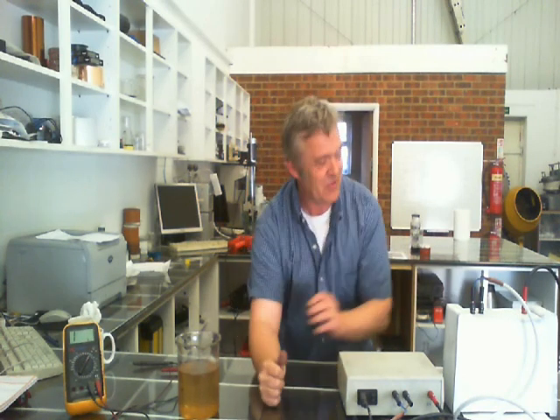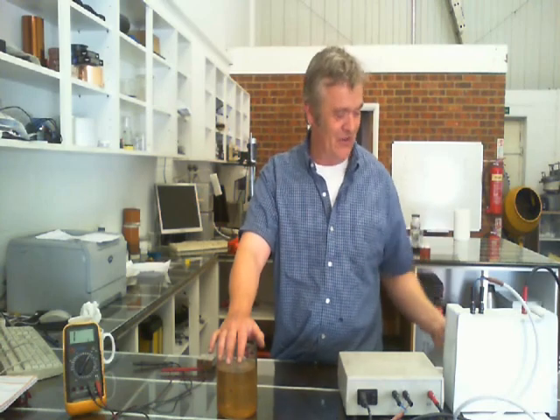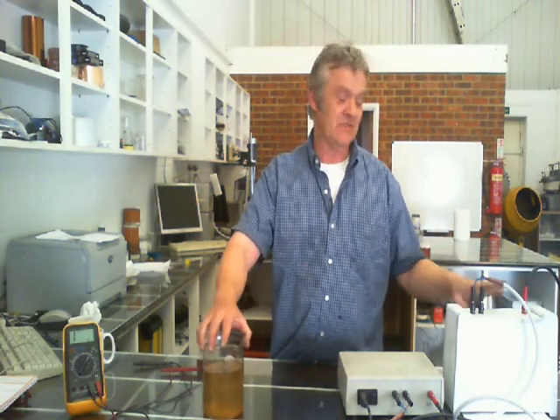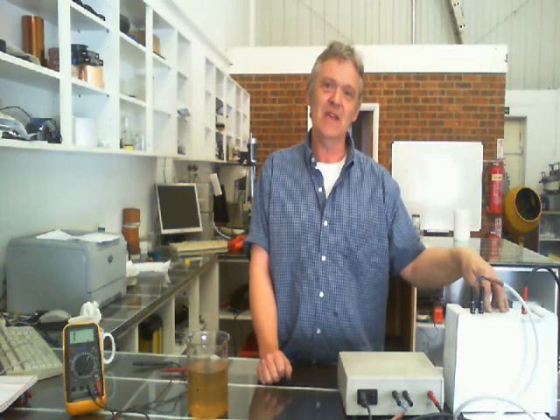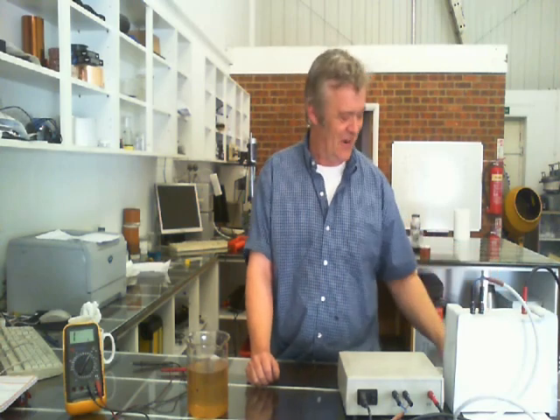I gave it a go actually, and it was a pain in the neck making little circles of plastic to put in your LightScribe drive. With the Pulse Light, all you've got to do is slide a bit of A4 under there, so this stuff will go through an inkjet printer. Graphene oxide ink will go through an inkjet printer, print on a little bit of paper, you can take your paper out and slide it under. Because there's so much more power in this, it takes no time at all — you give it about 10 to 20 flashes and the thing is reduced to graphene.